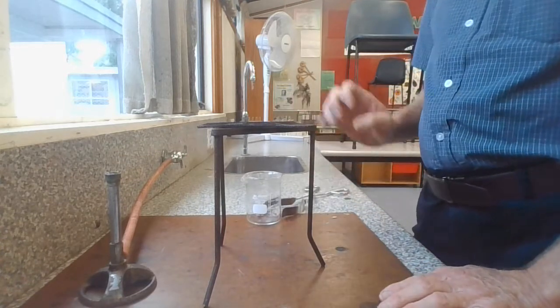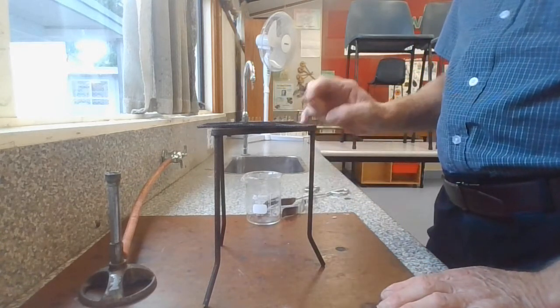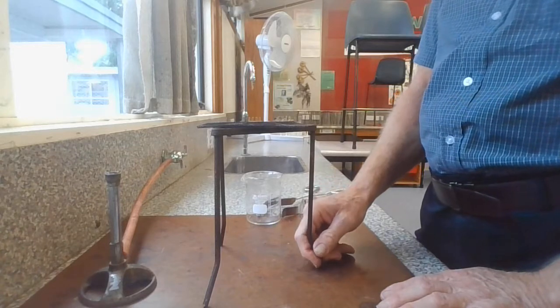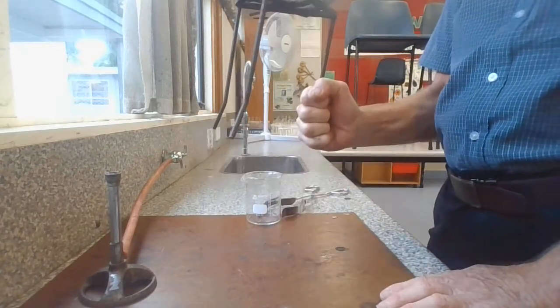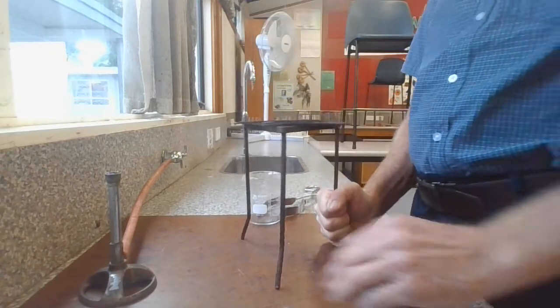The gauze will cool down quite quickly, or the metal part of the gauze will cool down quite quickly in a minute. When handling tripods after heating, hold them by the bottom of the legs.